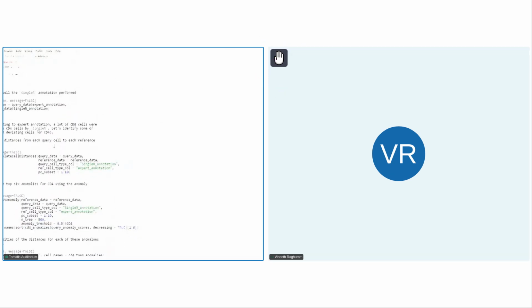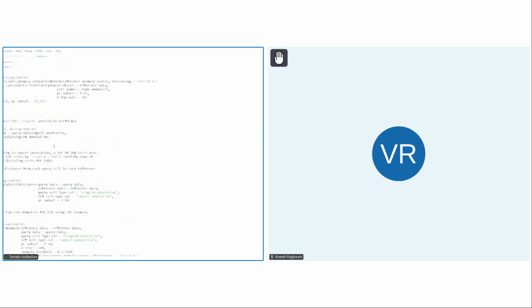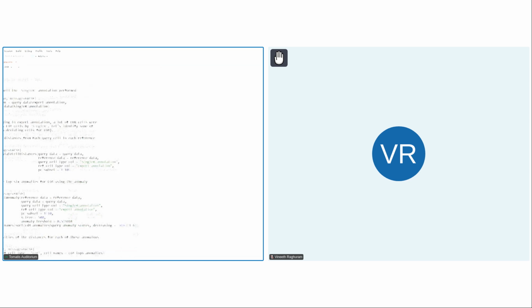I think maybe what I can do here is just go through one particular workflow that you might use to try to see what went wrong with the annotation. But this is just a very simple example. There's much more fancy things you can do with the functions that were implemented, but just for the sake of this workshop, there's a function called calculate cell distances. So this function will calculate the distance from every query cell to every reference cell. And then you can do some sort of analysis based on these distances. So let me run this first.